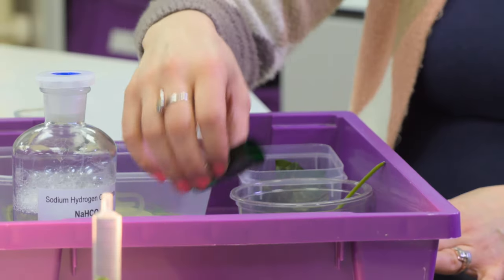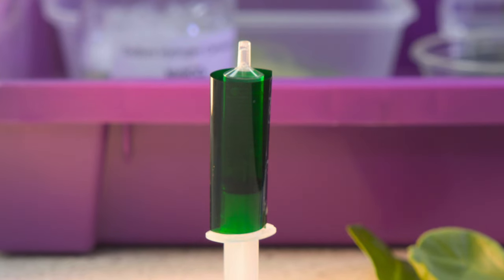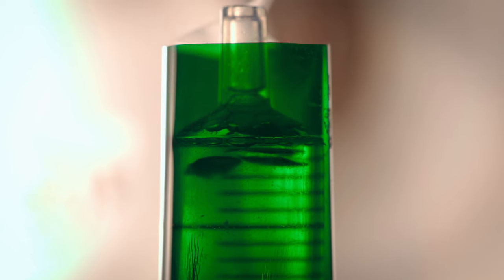Because we're looking at the difference between white light and green light, you just need green filter paper — cut it to a size which you can wrap around the syringe. The key science message is: comparing sun and shade plants, under white light both will photosynthesise. They produce oxygen, which makes the leaf disc less dense, causing it to rise. With the green filter on, the sun plant will show very slow photosynthesis if any at all. The shade plant should rise with the green filter on because it's used to photosynthesising using only the green light left by other plants.